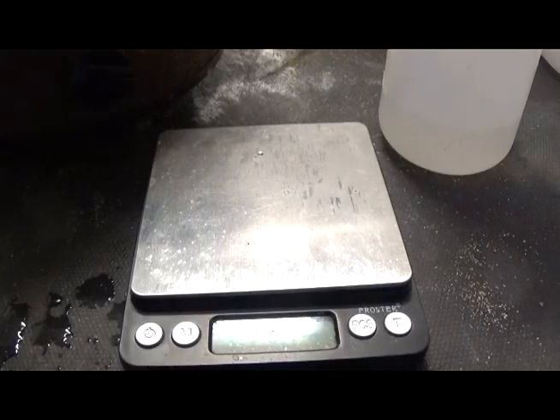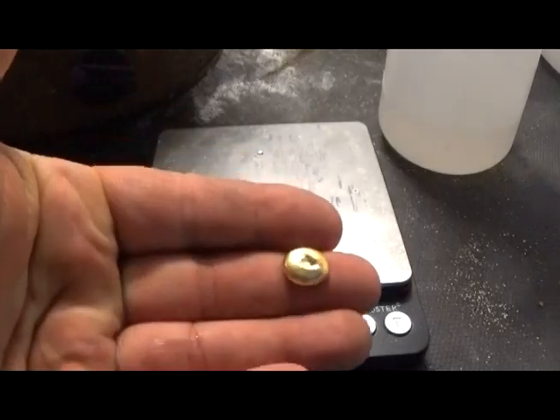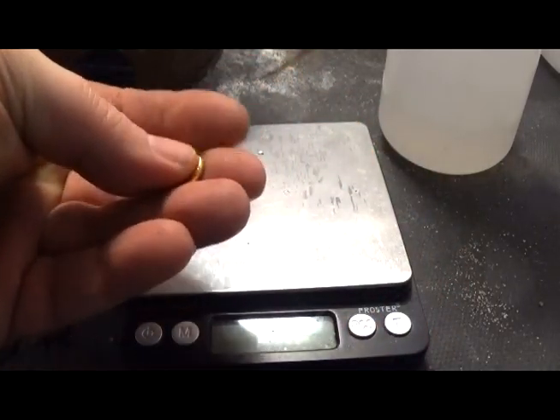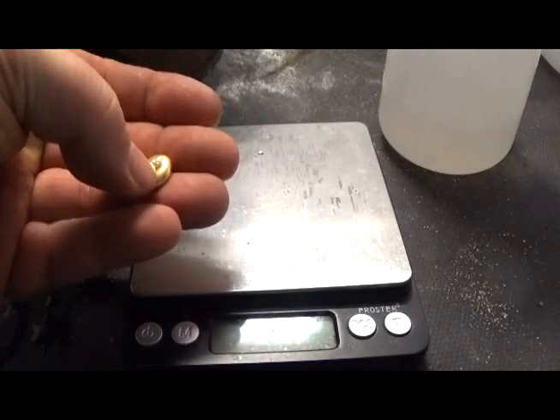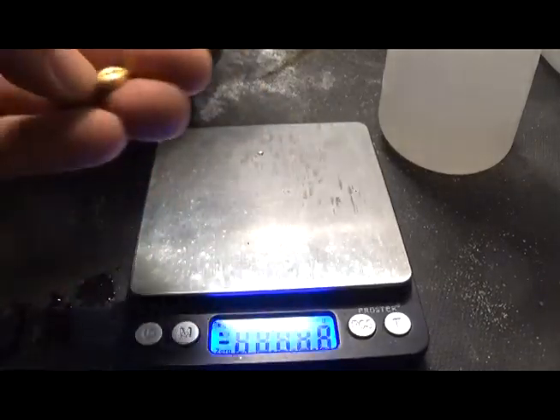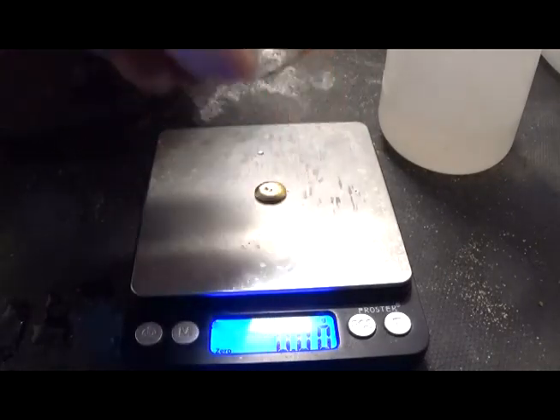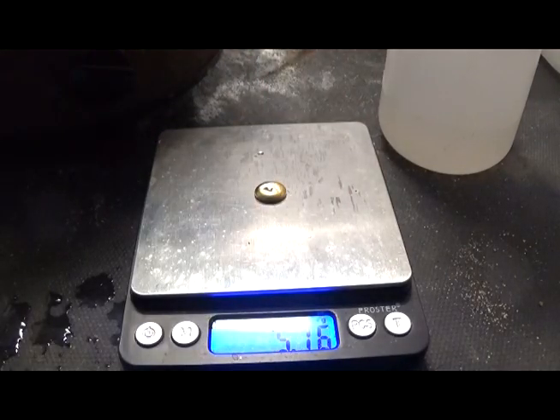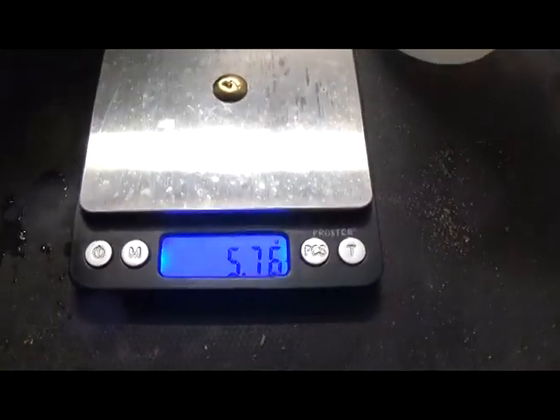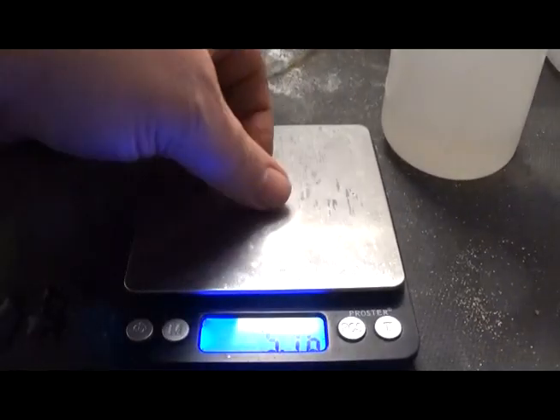All right. Now that's a nice little gold button. We're going to get a weight on this, and it's not fully clean. I got a little impatient. There's a little flux down in here, but oh well. There's a little dimple, but 5.76 grams. And that is considerably more than the 1.5 I predicted, because I don't know what I was thinking.